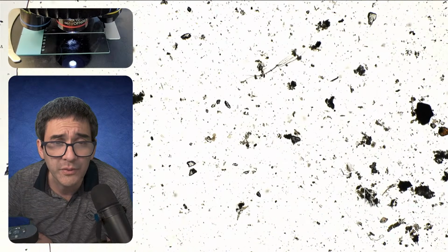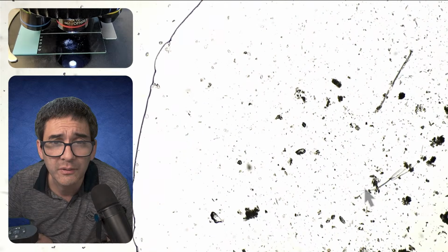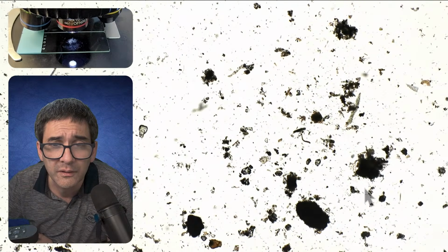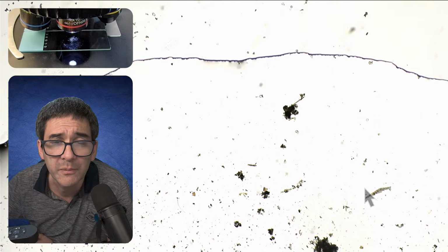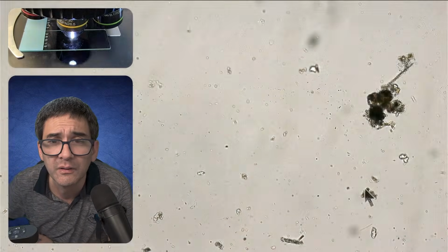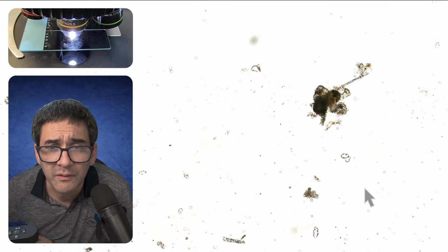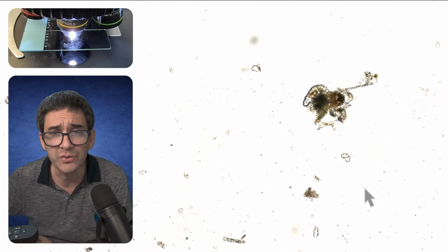You see how much other debris I was able to take up. But maybe I did not catch it. Or maybe I did. Actually, I did. So this now is good news.